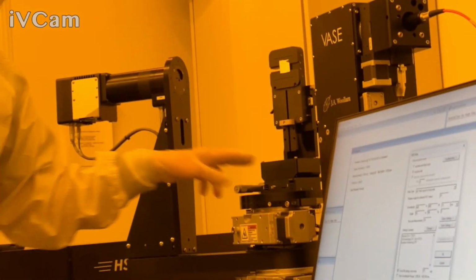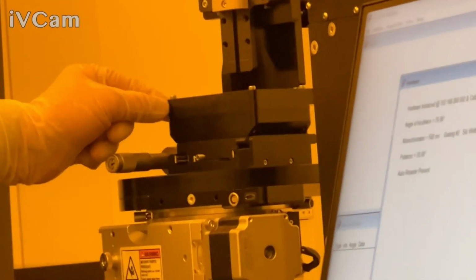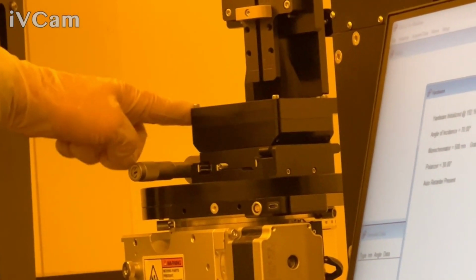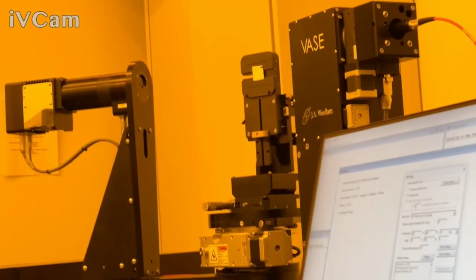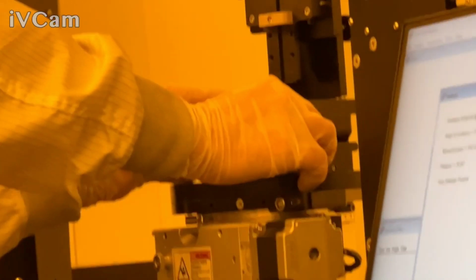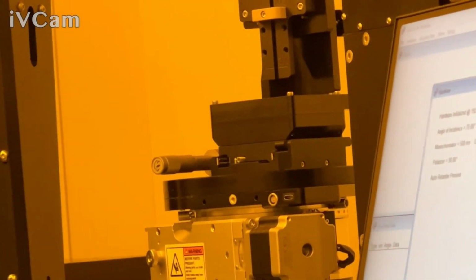So, sorry, there's your auto shim. I haven't seen it on this stage. It's usually over here if they have that, or it's a little embedded one over here. So that also is there. So that's helpful, so you don't have to put that shim in yourself.